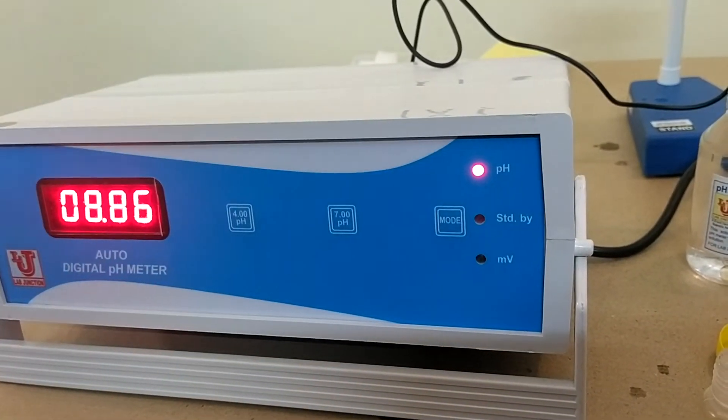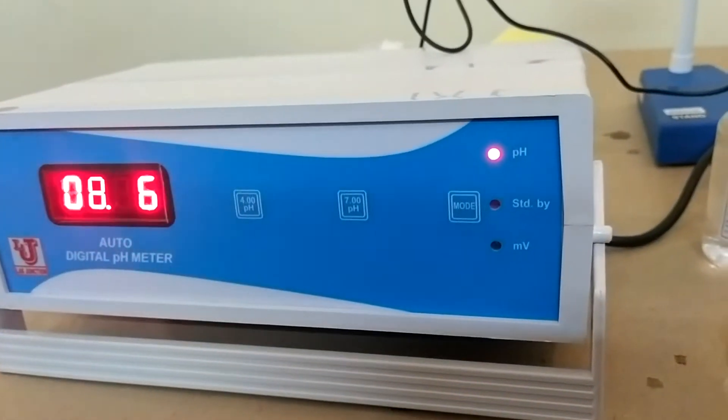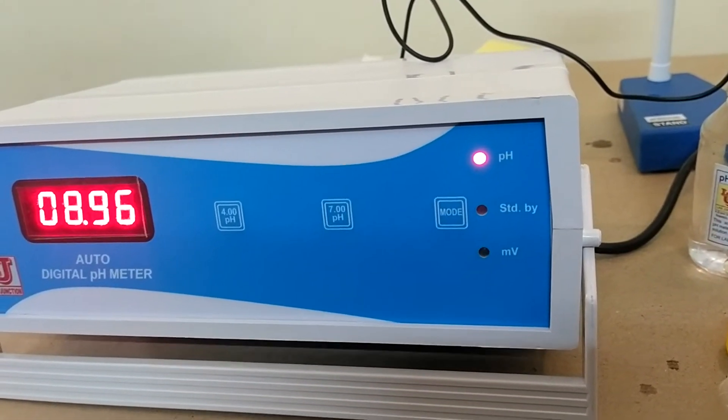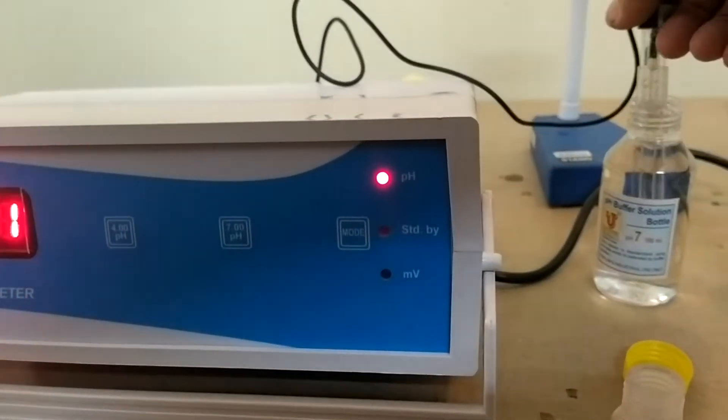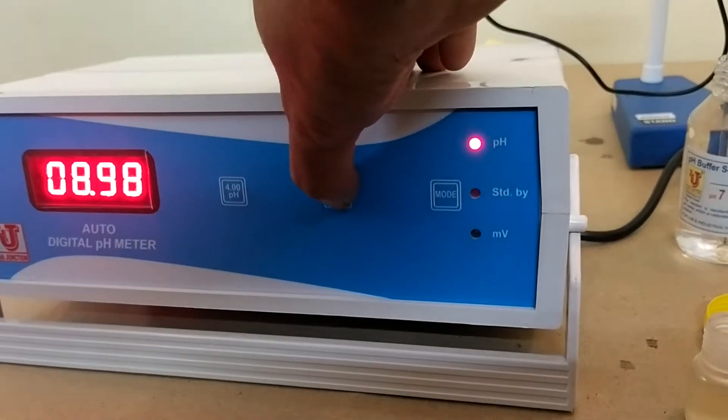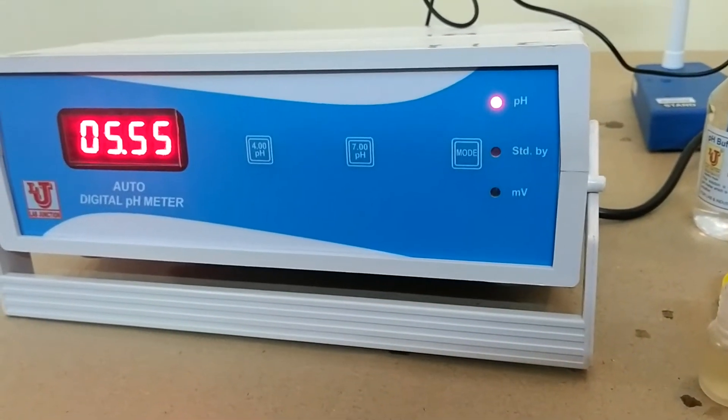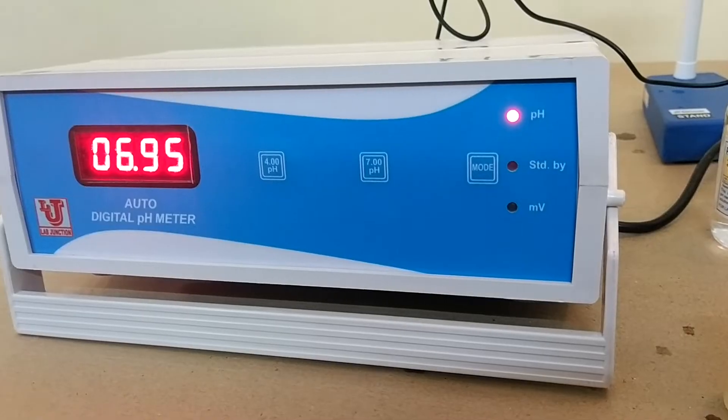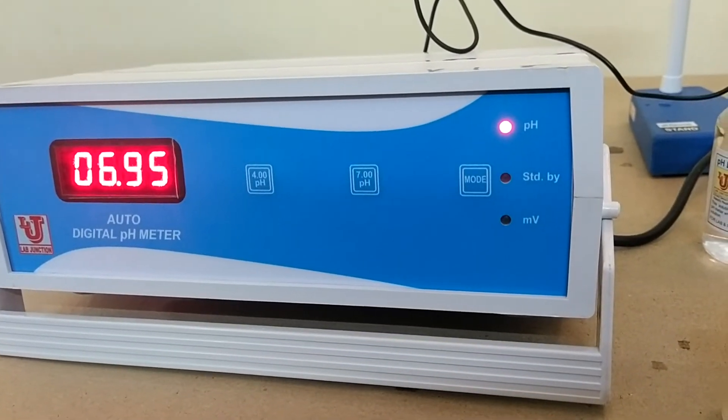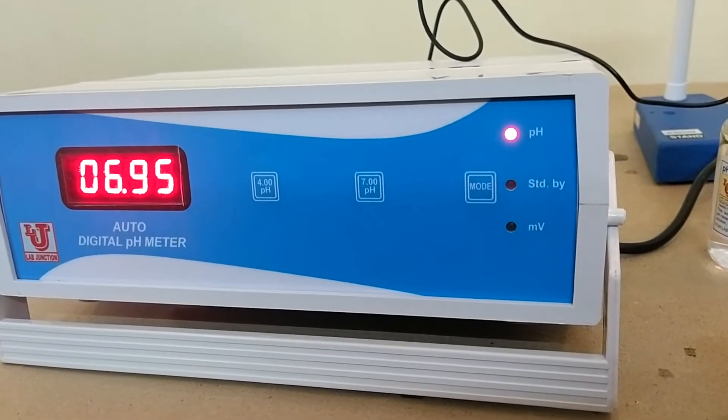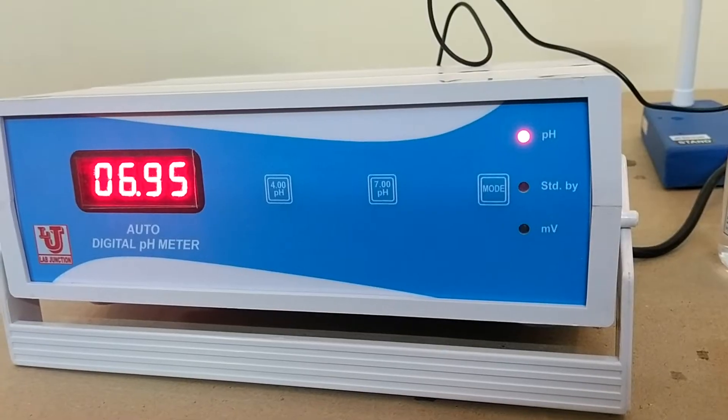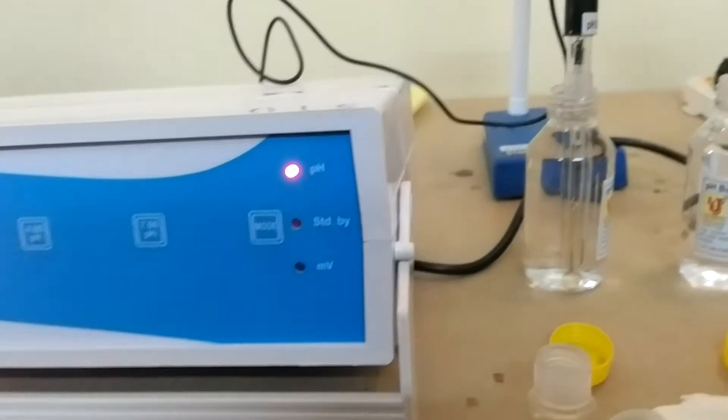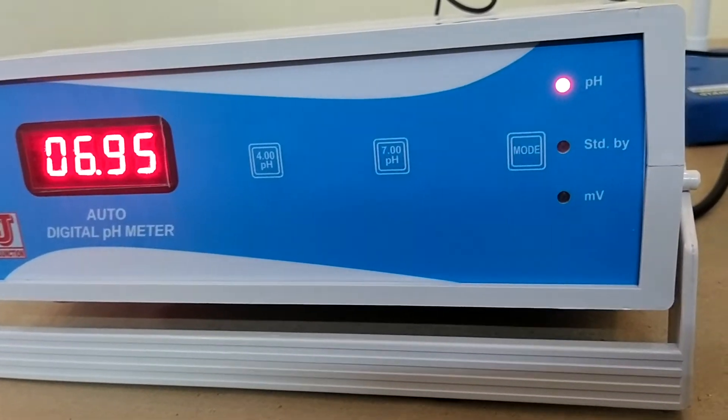It takes 25 to 30 seconds to attain its exact level. If buffer solutions are not homogeneous, then shake it properly. Then your reading comes exact 7.